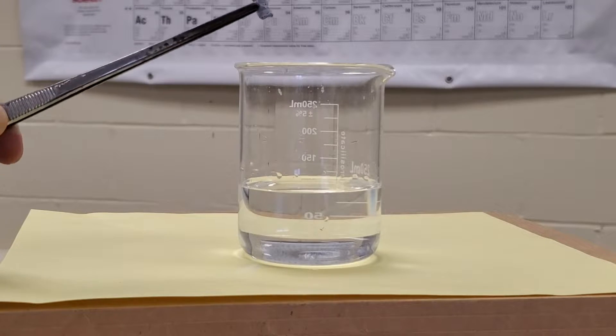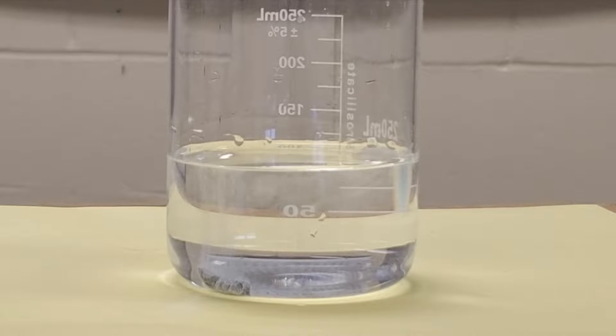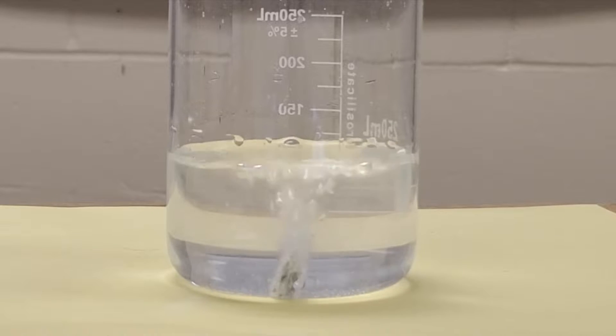This is calcium. We'll take a closer look in a bit and this is its chemical reaction with water. It takes a second or so to get going, but you see that it bubbles hydrogen gas violently.